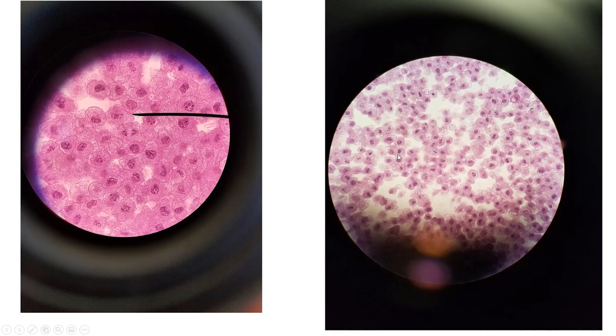And then lastly, just to give you another couple of views, here's definitely a metaphase right here with the chromosomes lining up in the middle. And then you can also see, and this one's a little tricky because you can't see the whole thing, but this looks to me like anaphase, where you can see these chromosomes going that way and these going this way. But I could be off there. If this is not what I think it is, that could be metaphase. So with metaphase, you're just looking for that straight line going across.